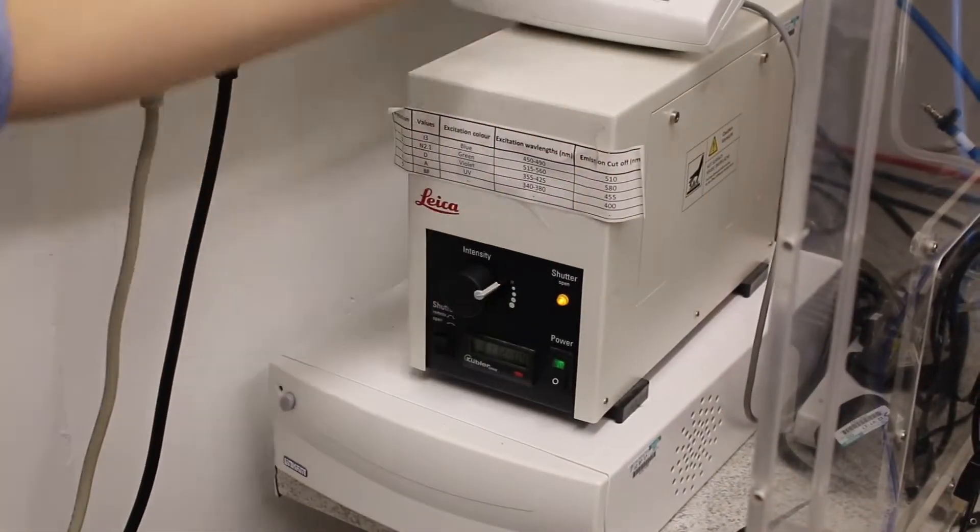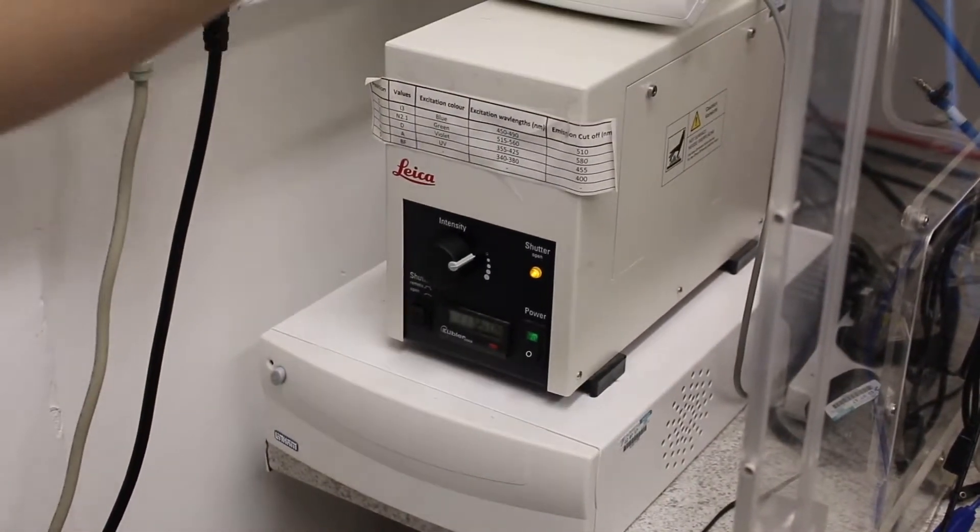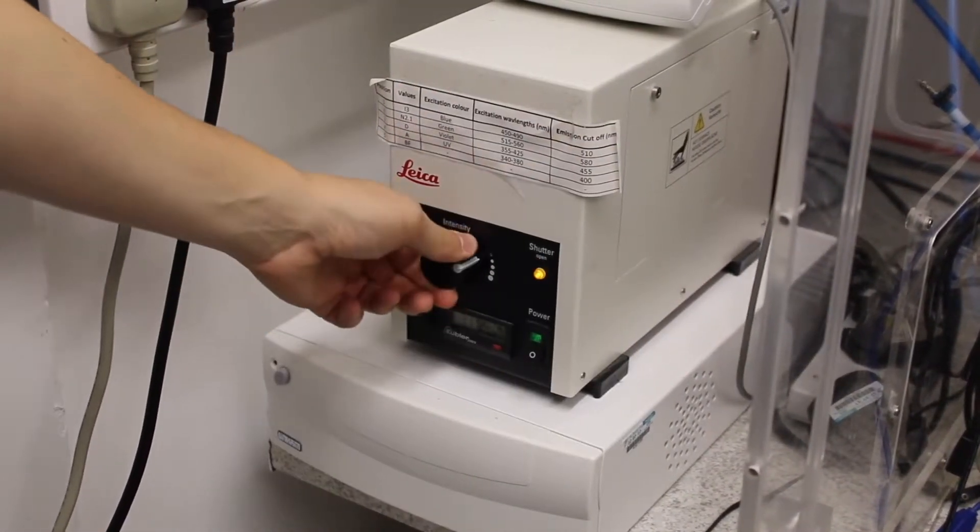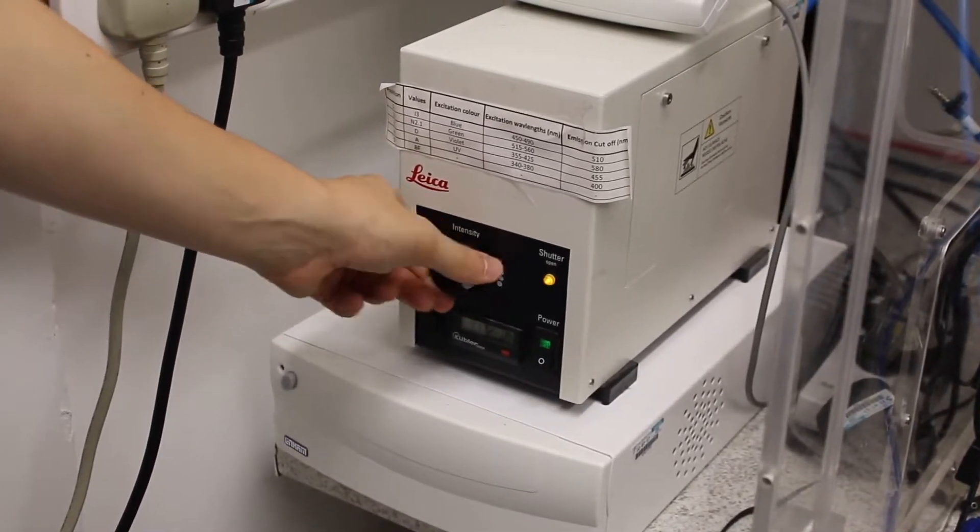That means that light is now coming out of the fluorescence box to the optical fiber that goes to the sample. There are four different intensity positions here that you can choose.